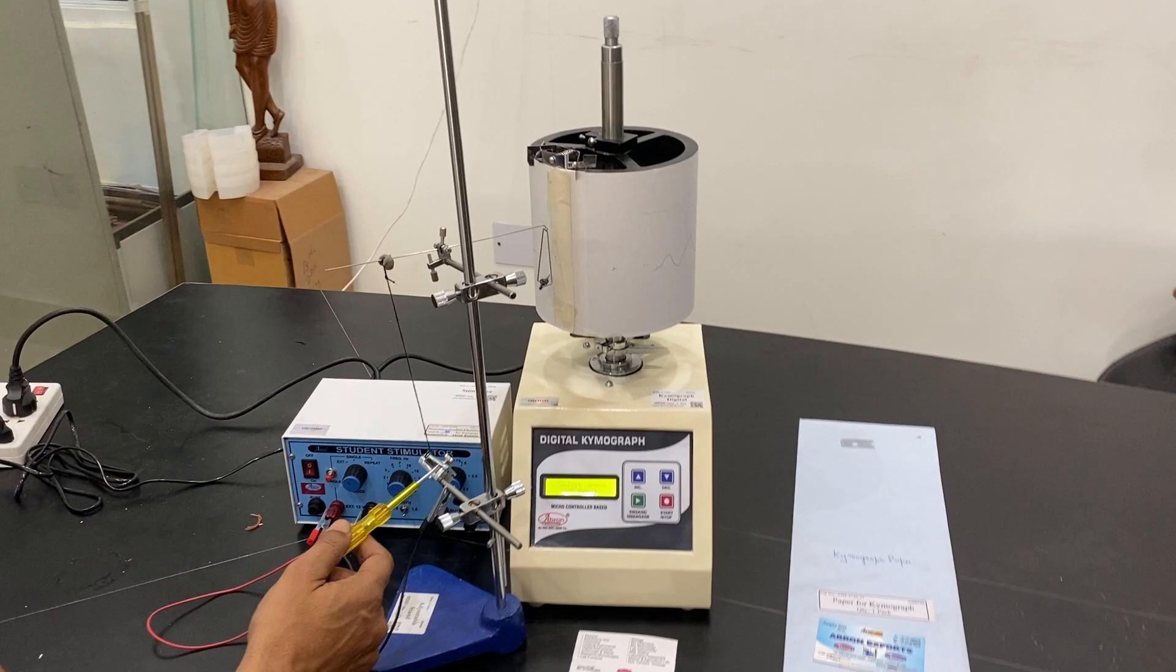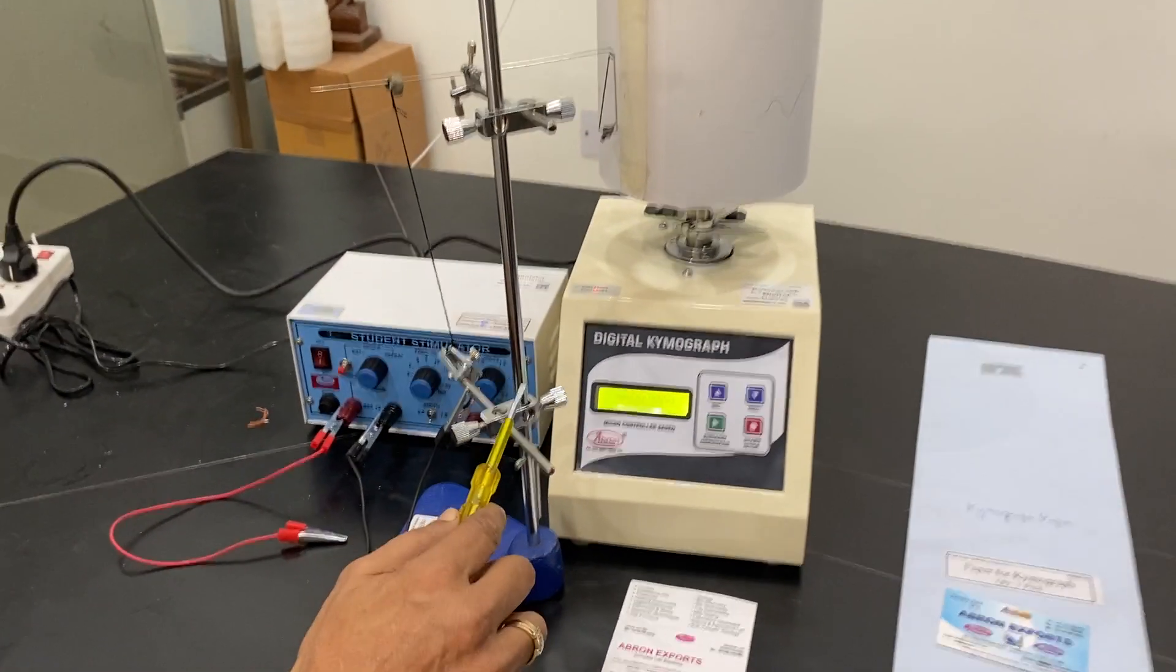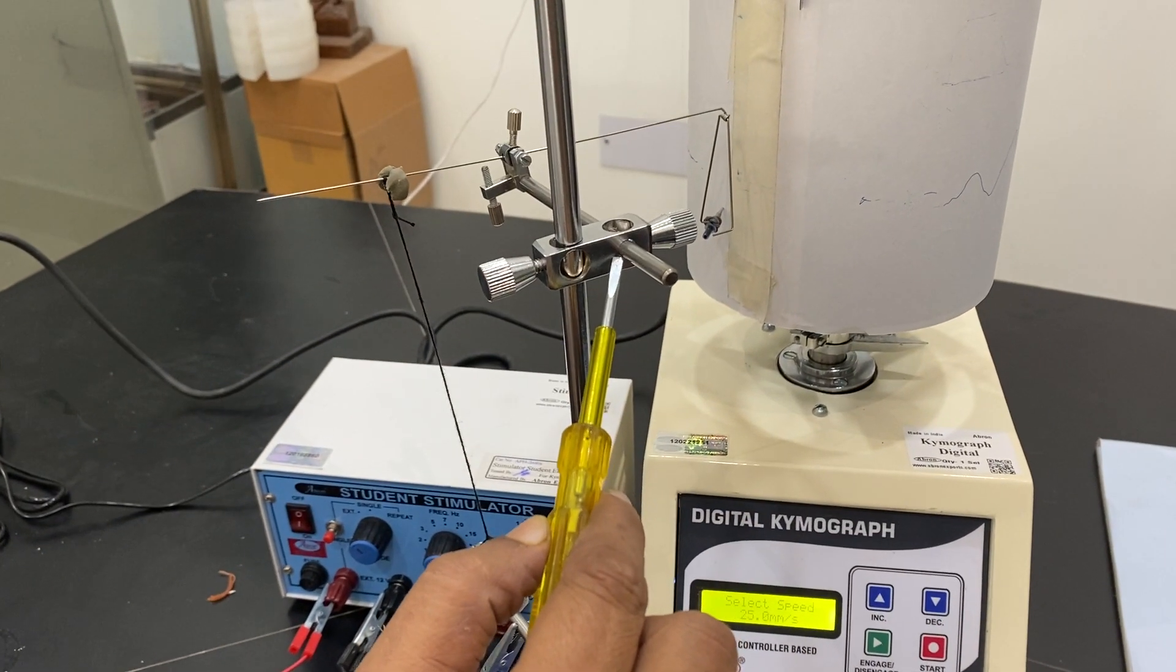This is the muscle lever and this is the muscle clamp, X block and stand base, and this is again X block.